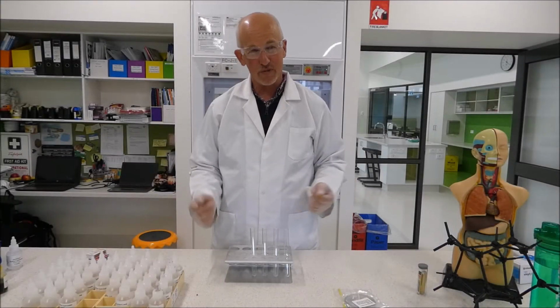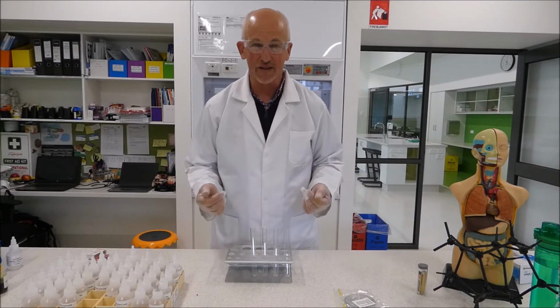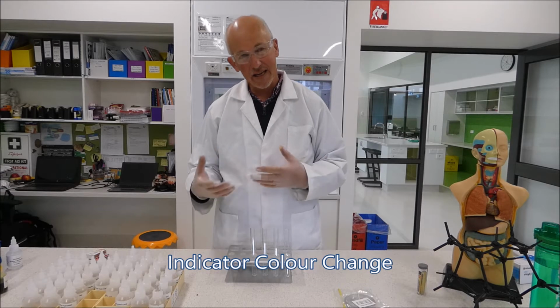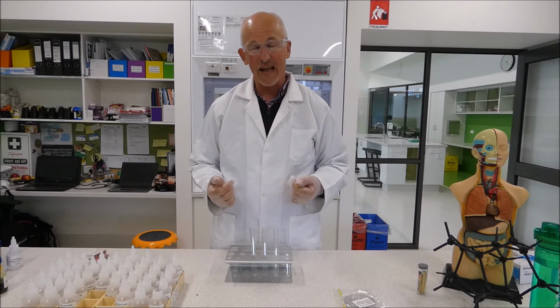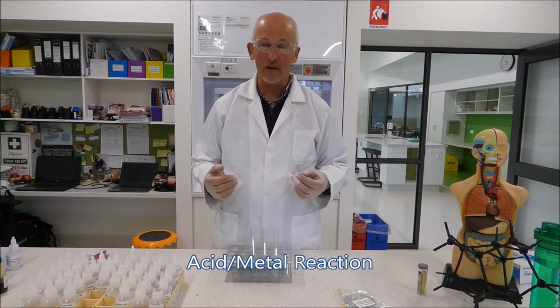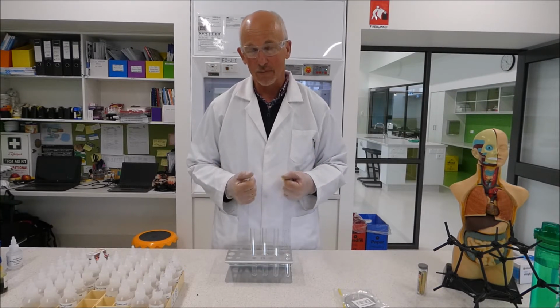The purpose of our experiment today is to observe 4 different chemical reactions so we can see chemical change in action. The first will be a colour change reaction where we're going to look at our indicator paper and how it changes colour with addition of an acid. The second one is going to be an acid-metal reaction where we're going to see what happens when we add acid to metal, what the products formed are and how we can observe a chemical reaction is taking place.